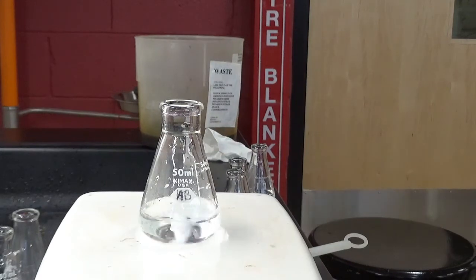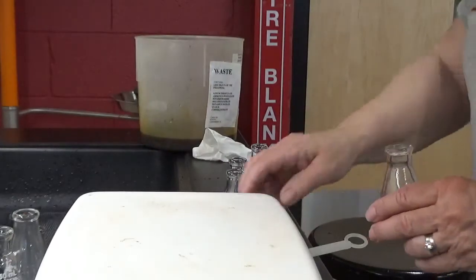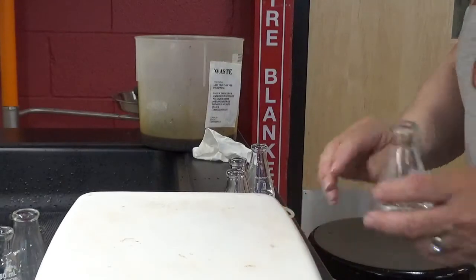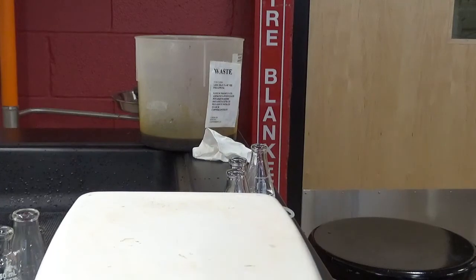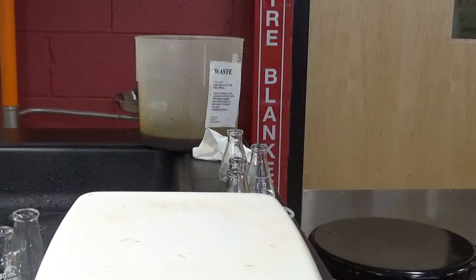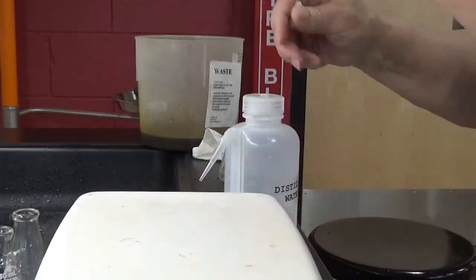Try one more. Because this one I just made, so we'll just do it once. Dr. Cooley and I are tired of doing this. This thing that says B, it's the solution I made. I think I screwed that one up. No, I don't know. I just grabbed the flask. That doesn't matter because I made one and you made one.